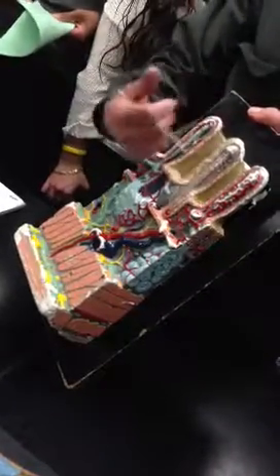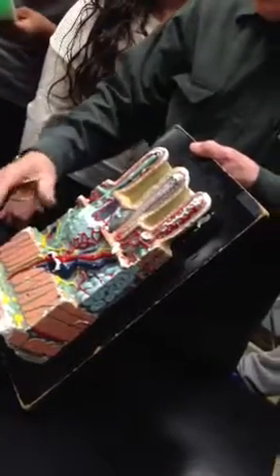I'm not going to ask you for submucosal. Meissner's controls the pumping up and down, the waving back and forth, the secretion and stuff like that. And Auerbach's controls peristaltic waves for the most part. Basically, that's all you need to know.